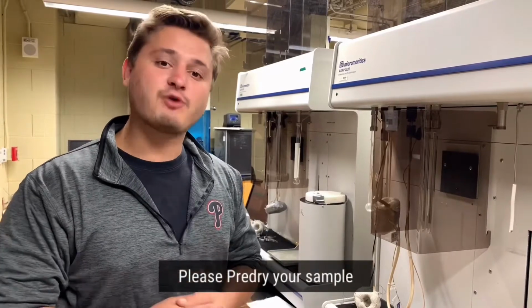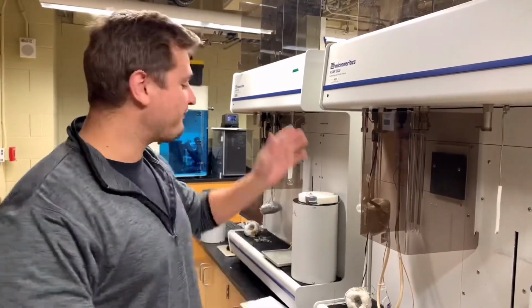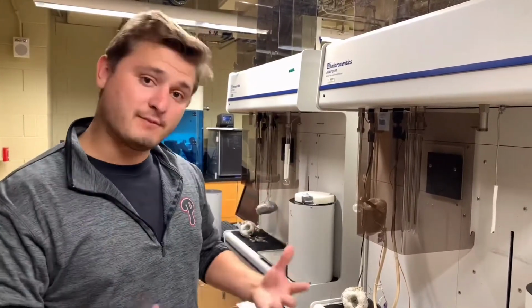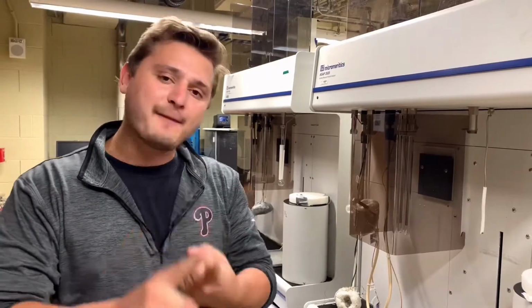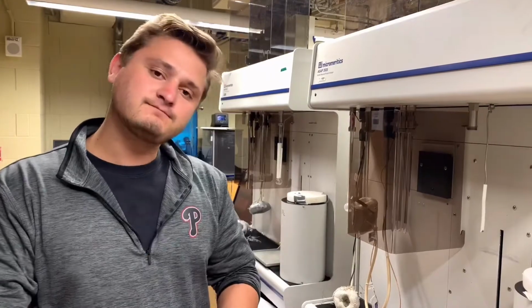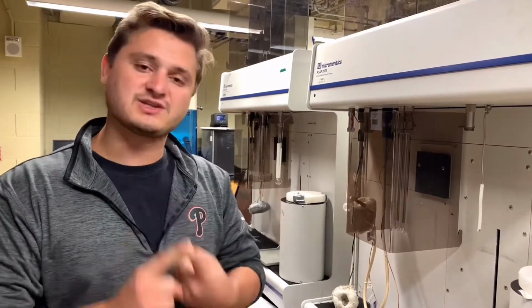You must pre-dry your sample in an oven or on your schlenk line with a vacuum before putting on your degas. This prevents a lot of solvent molecules, which are typically organic solvents, from getting up into the instrument and corroding or creating leaks within the instrument. So the first thing you absolutely must do is dry your sample in an oven or on your schlenk line for 24 hours before running your sample.